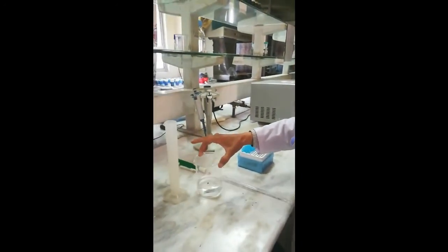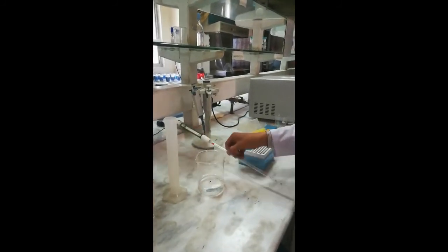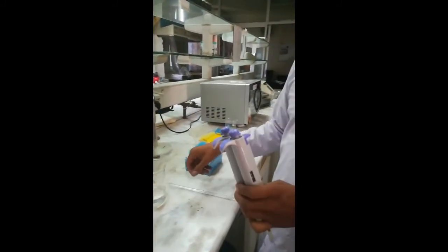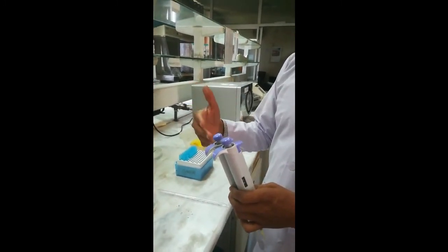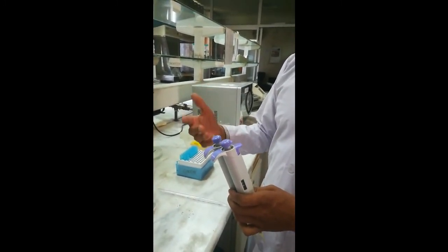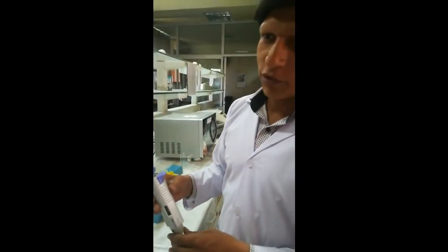Now we know how to use these micro pipettes, measuring cylinders, beakers, and glass pipettes. In the next practical we will learn about some more equipment used in food analysis. Thank you very much.